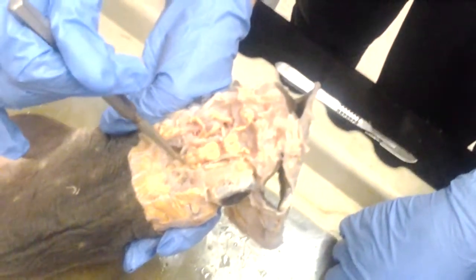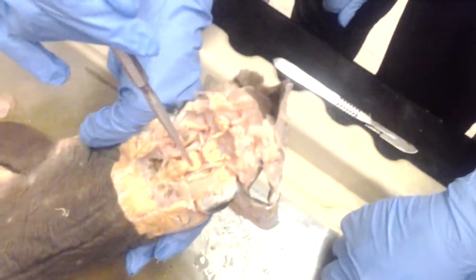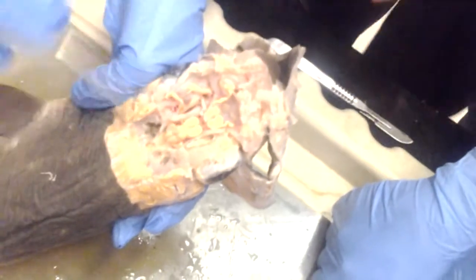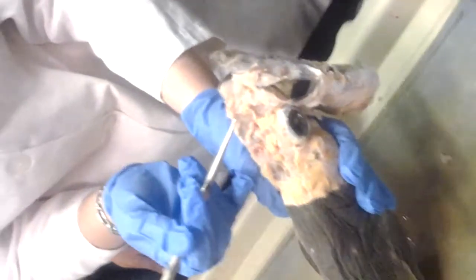So we have the medulla oblongata here, with the fourth ventricle in the middle and the telechoroidea on top. This big round thing is the cerebellum. Then we have optic lobes here, and the diencephalon in here with the telechoroidea again. What's the telechoroidea? It's a membrane. Did you read the chapter in your book? No. When you read it, it'll make more sense. These are the cerebral hemispheres. Olfactory tract, olfactory bulb, olfactory sac.